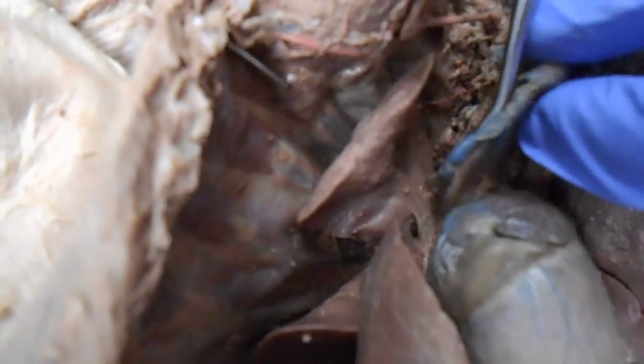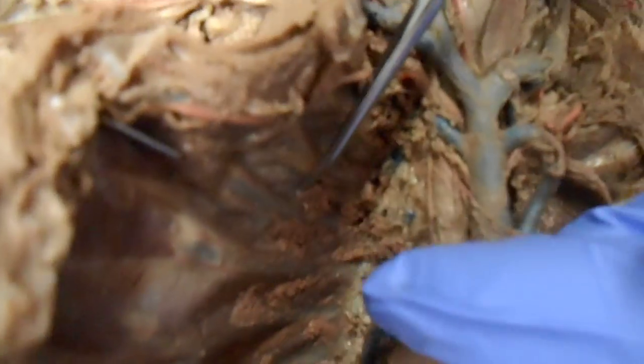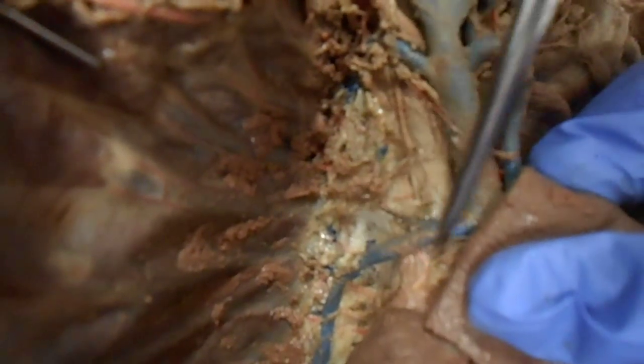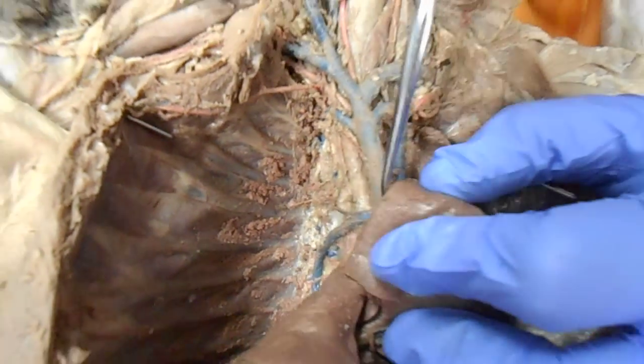Up underneath the cat's chin is the transverse jugular. And going back to the heart, over here we have the azygos vein. It's going to be under the lung, and going to our left, but the right side of the heart. And there are the veins of your thoracic cavity.